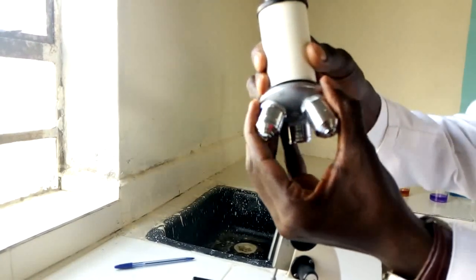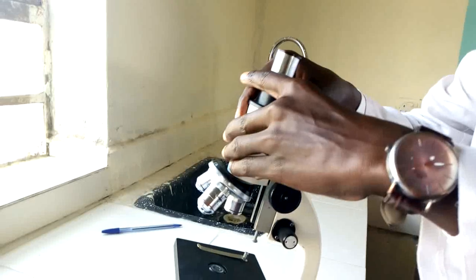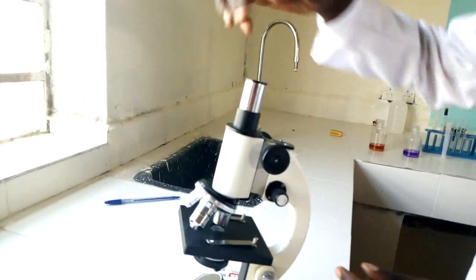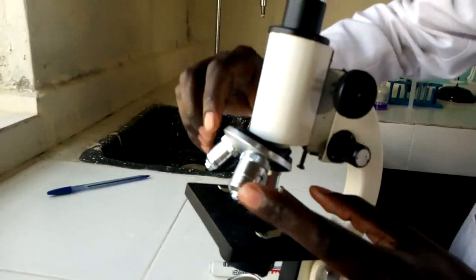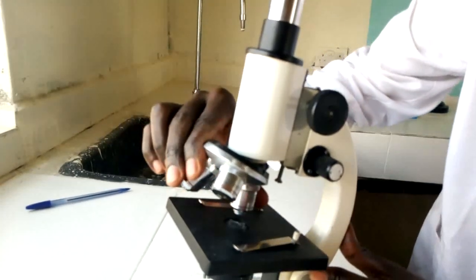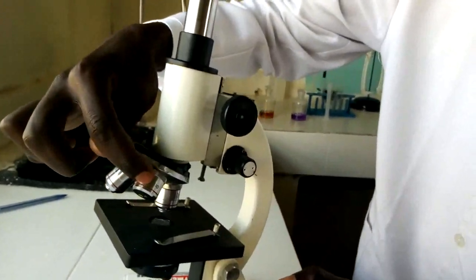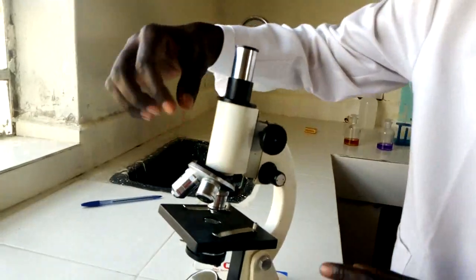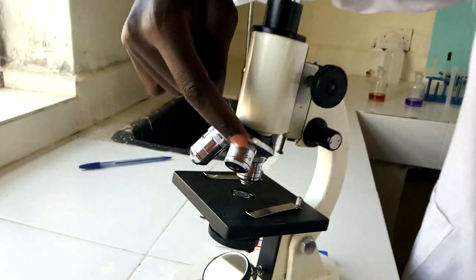Let me return the body tube back to its position. We also have the revolving nosepiece down here. The function of the revolving nosepiece is to enable selection of different objective lenses that you need to use, and we can also say that the revolving nosepiece holds the objective lenses into position. We have three objective lenses.